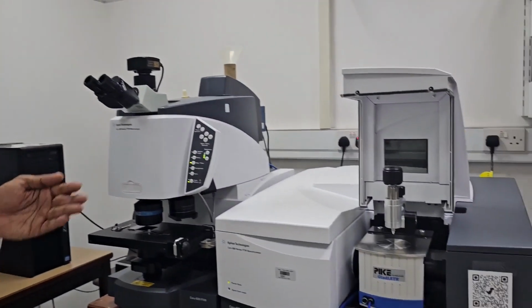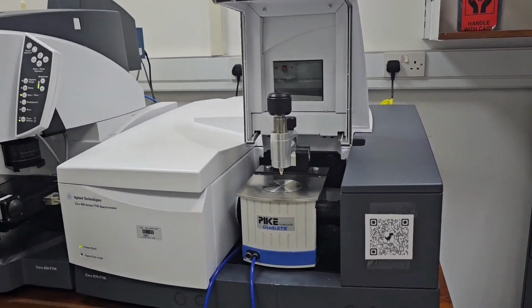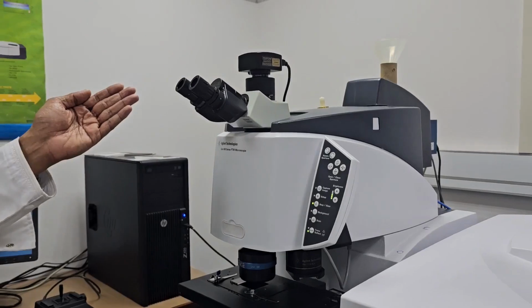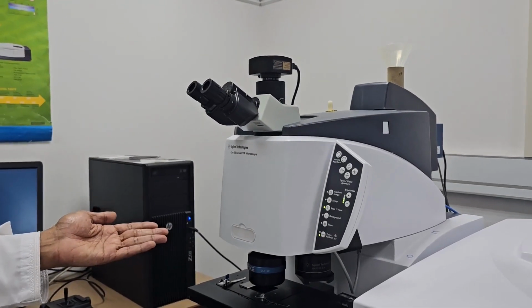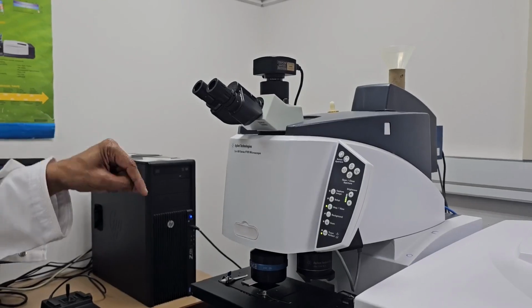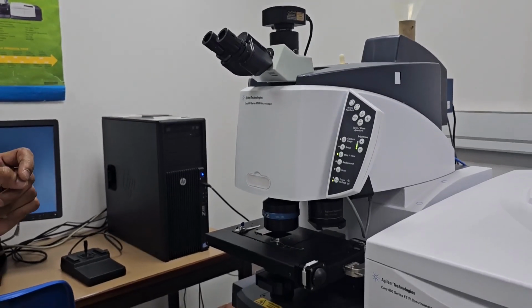Bismillah ar-Rahman ar-Rahim. Thank you, Professor Shafour, for inviting me today to talk about the FTIR microscope. An FTIR microscope is like any other FTIR machine, but the main difference is that we have two parts. The first part gives the infrared beam, and the second part is the microscope. In the microscope, we have different lenses with different magnifications, where the beam is focused into a very small point.